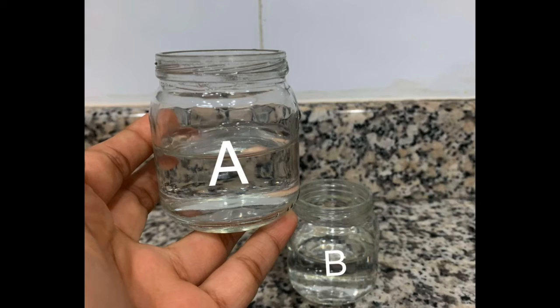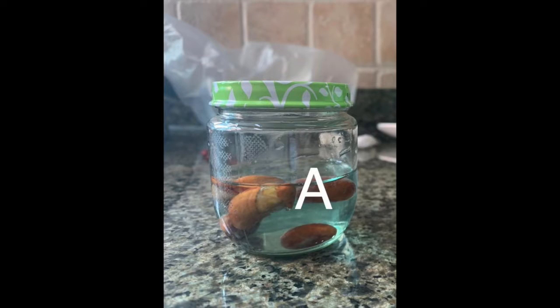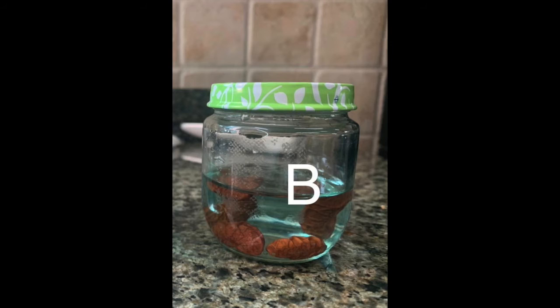Step 1. Fill 3/4 of each glass container with water. Step 2. Pour 5 milliliters of bromothymol blue into each glass container. Step 3. Take the 5 germinating seeds and place them in container A and put the lid on. Step 4. Take the 5 boiled seeds and place them in container B. Do not forget to put the lid on.